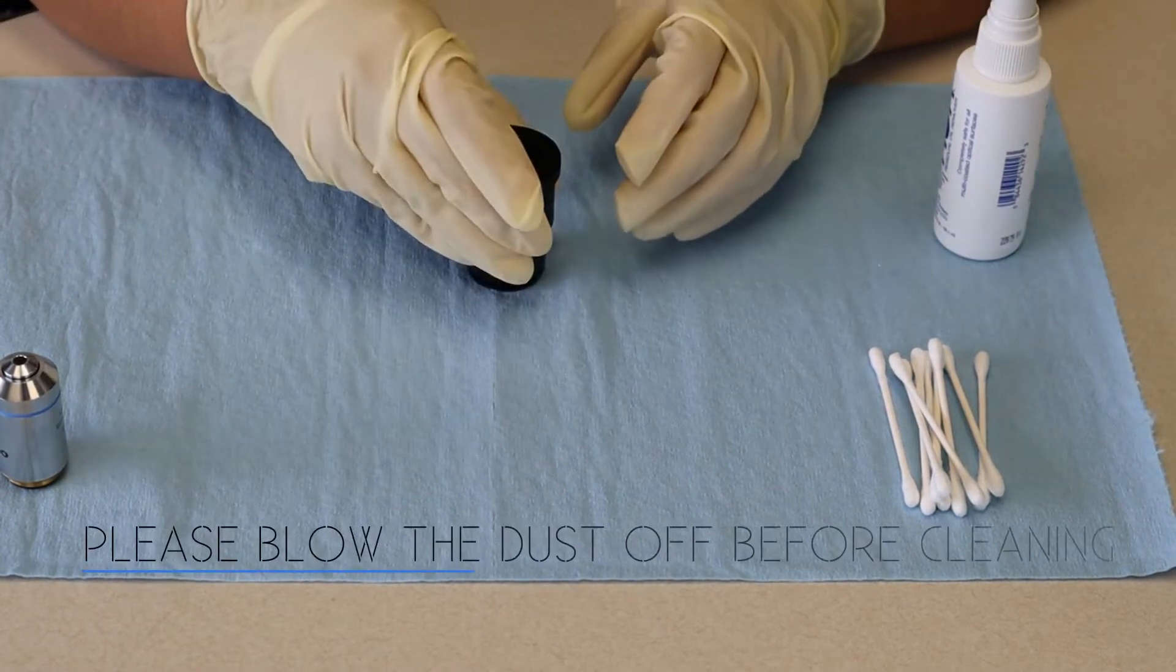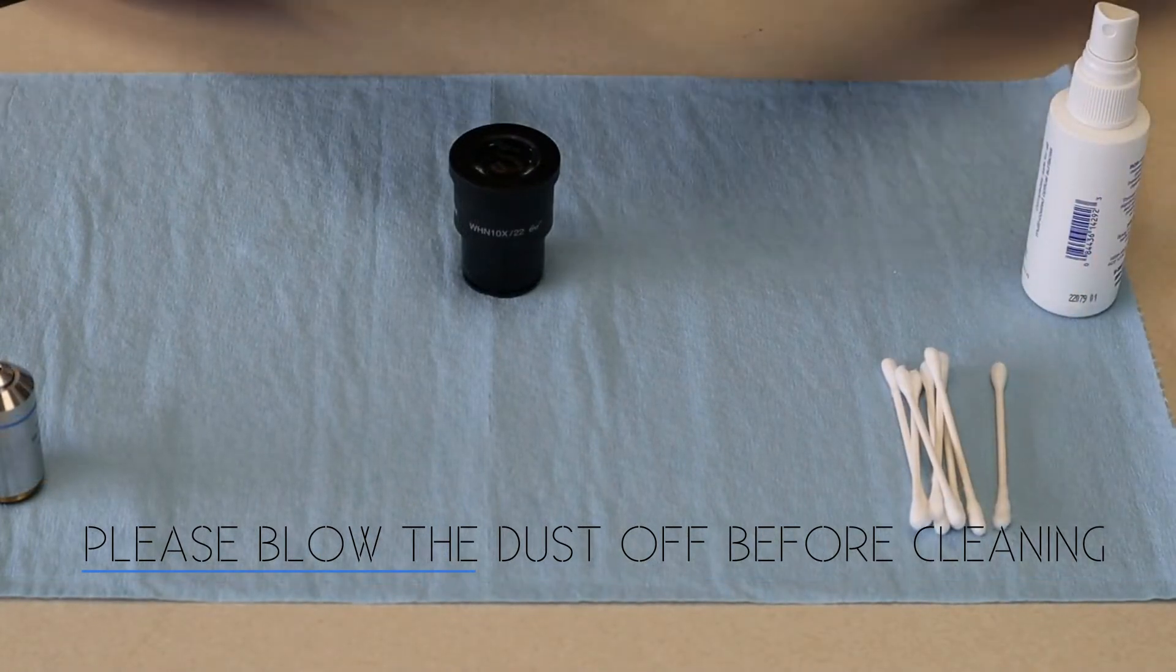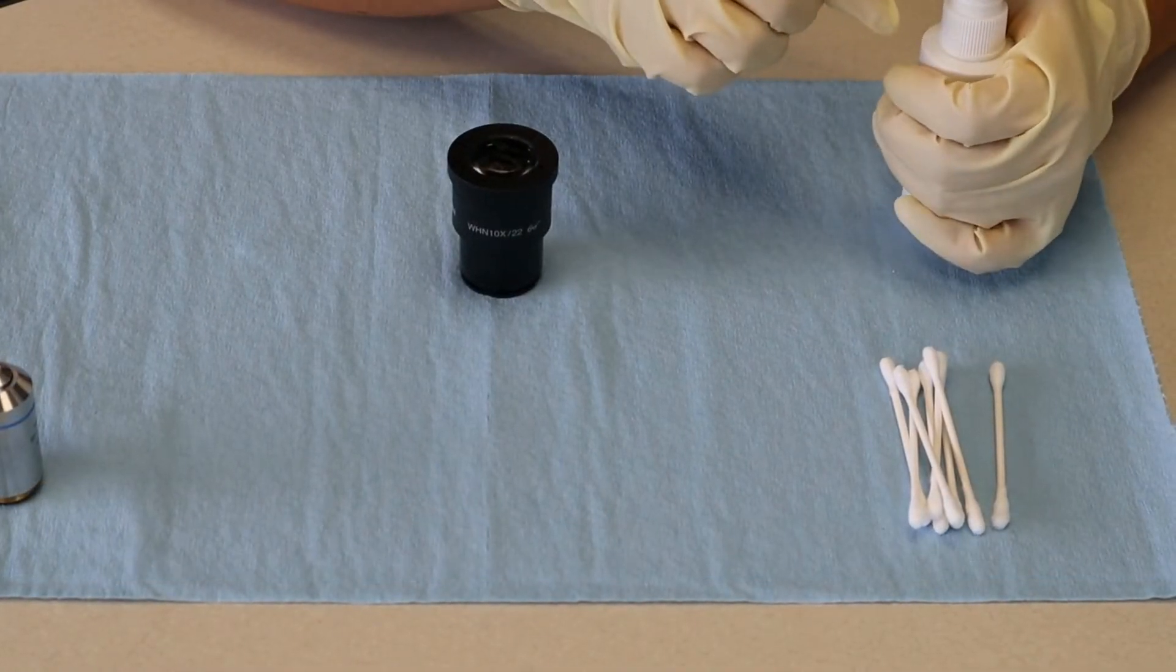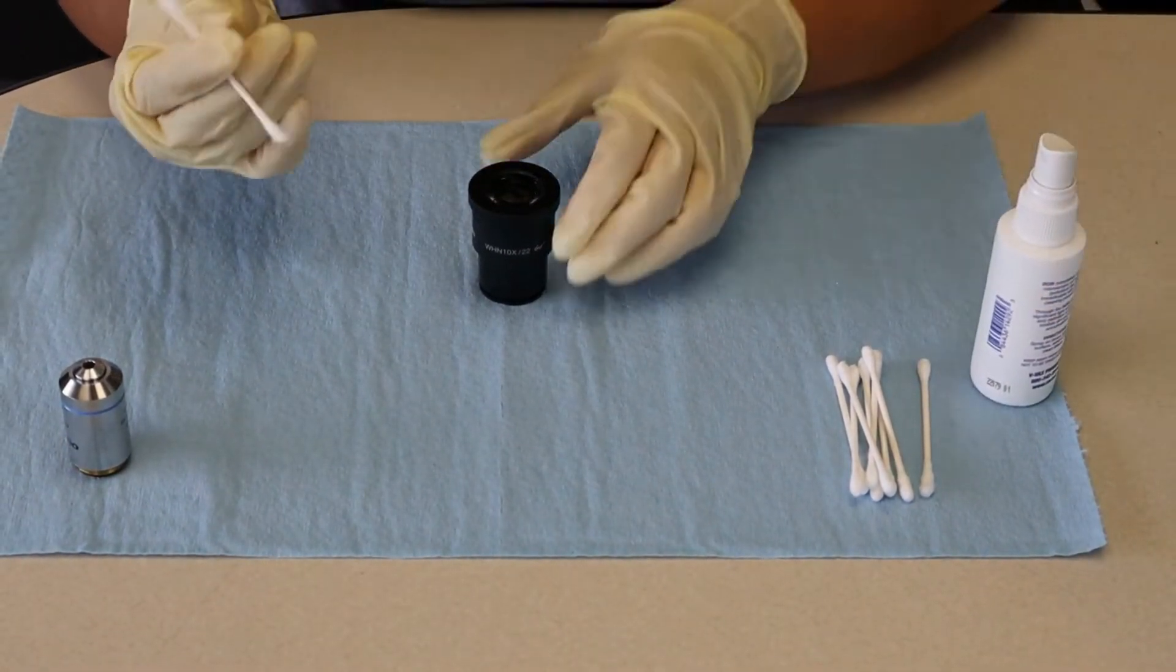We're going to start off with our eyepiece. Okay, so we're going to grab our cotton swab and we're going to get this wet. You don't want it to be soaking wet, just a little spray.